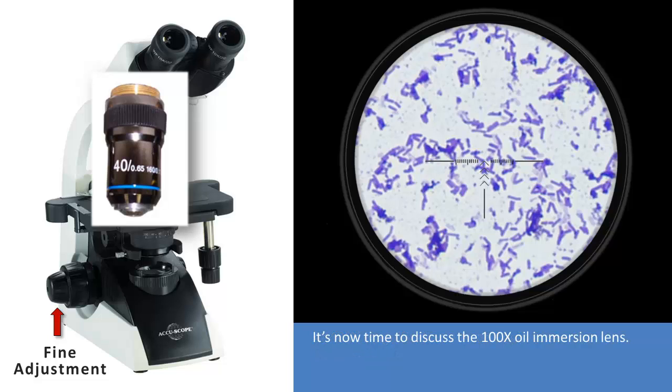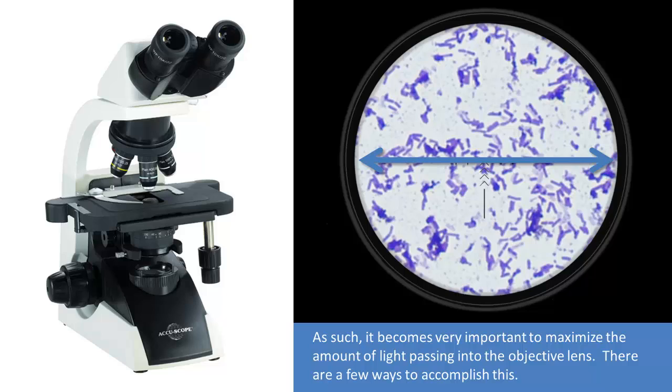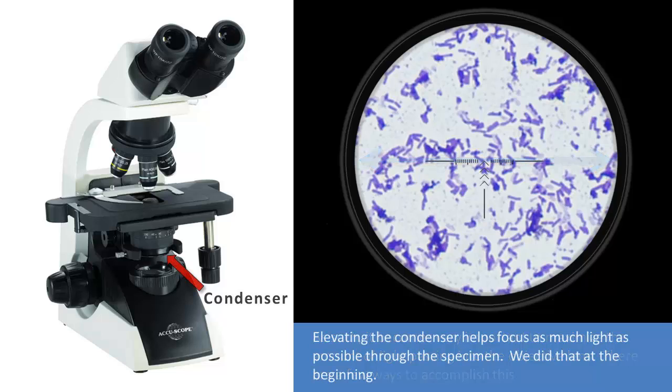It's now time to discuss the 100x oil immersion lens. As the diameter of field continues to get smaller, there is less area for light to travel through the specimen and create an image. As such, it becomes very important to maximize the amount of light passing into the objective lens. There are a few ways to accomplish this.